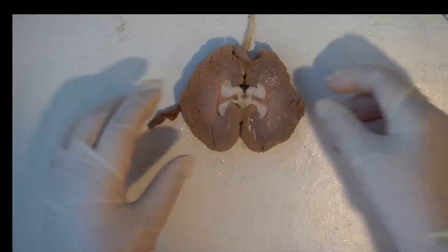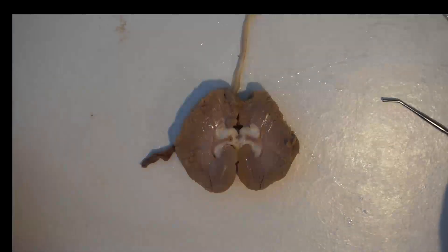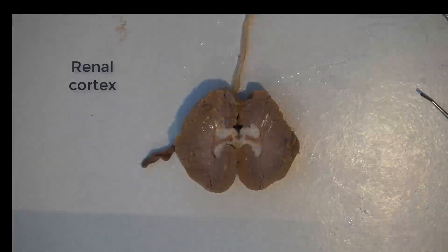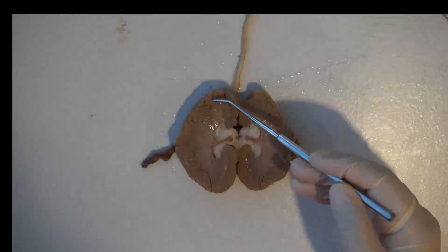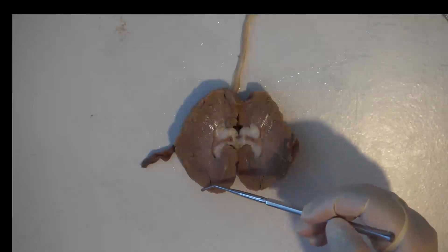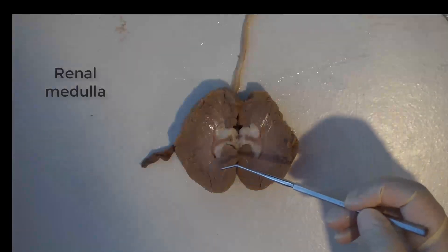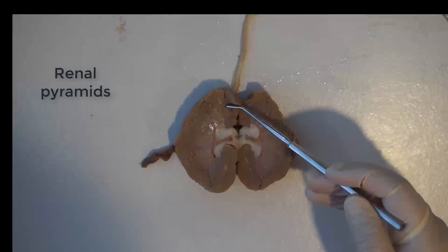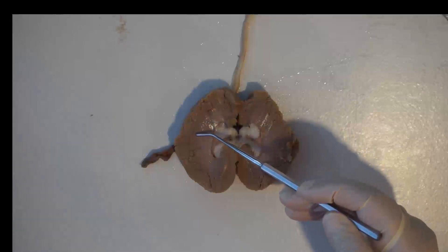Now once you get your kidney cross-sectioned and divided in half, you should be able to see a few layers. The first layer is the renal cortex, which is the grainy outer layer around the outside of the kidney. Inside that is a lighter portion called the renal medulla, which is composed of the renal pyramids — triangular-shaped portions of the renal medulla that are a little harder to see on this kidney.